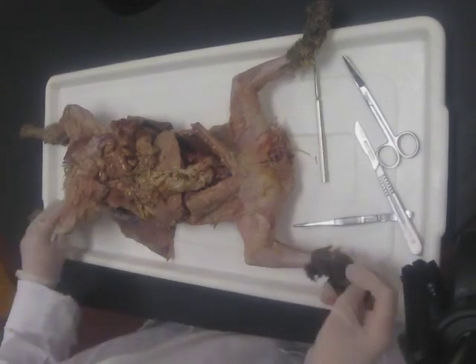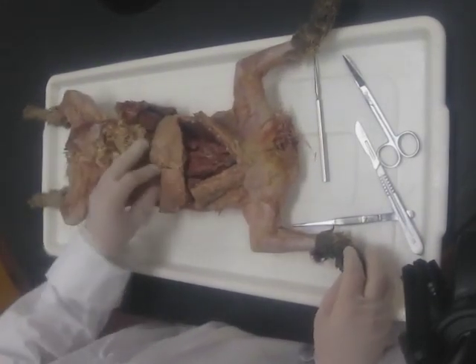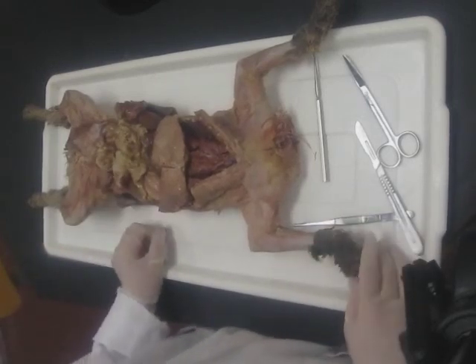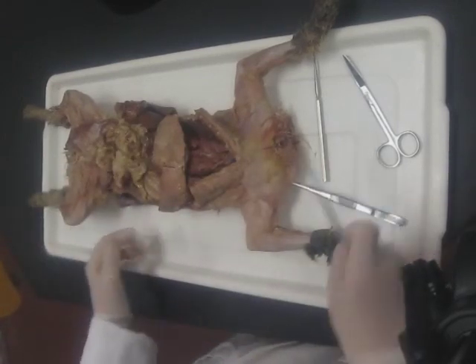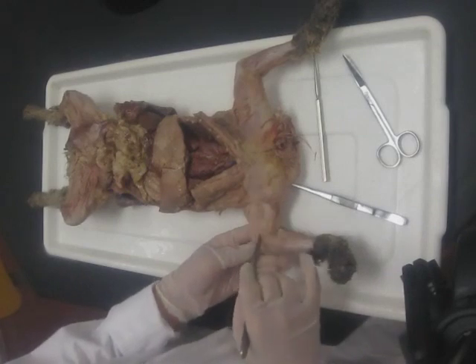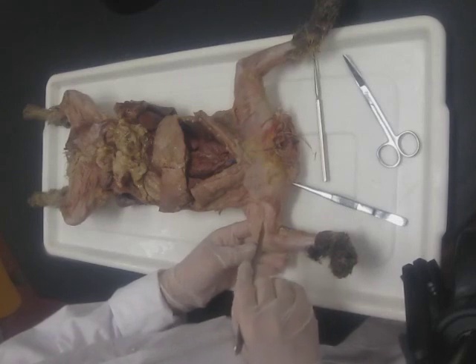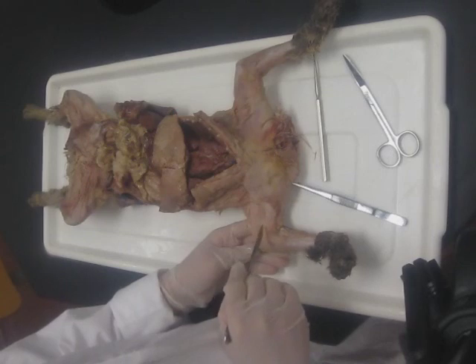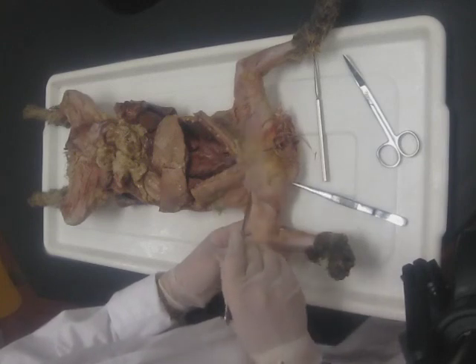Today's dissection covers the arteries and veins of the upper extremities and thorax — the vessels above the diaphragm. The first thing we need to do is a muscle dissection along the left upper limb. We use the left because that's the side the company actually injects the paint, so the left vessels are more likely to have paint in them. The right side, not so much, so we're going down the left.